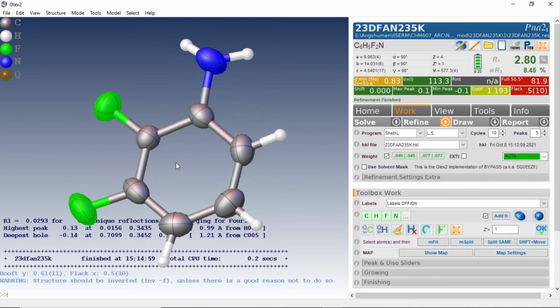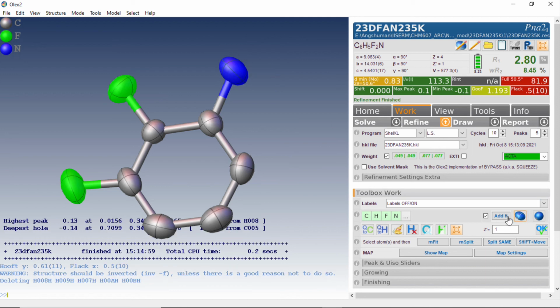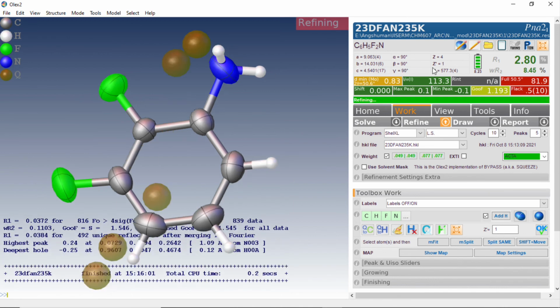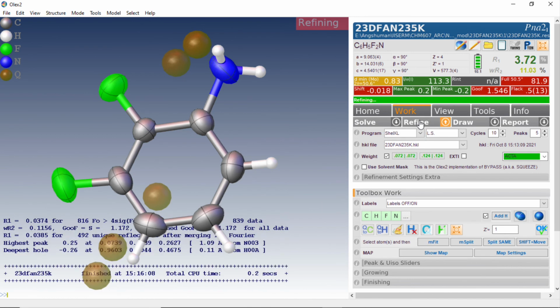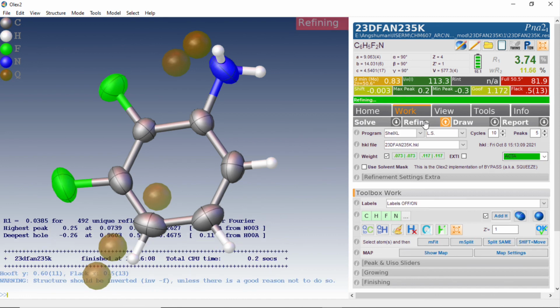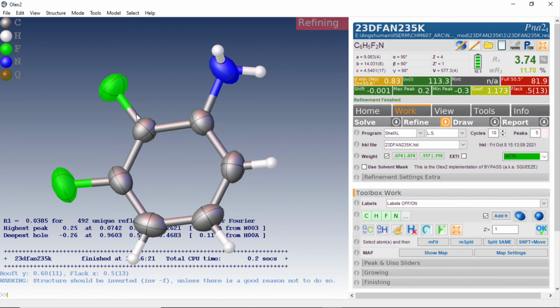Now what we see here is, although those hydrogen atoms were coming up, the bonds are not at 120 degree and all that. So it is always advisable not to refine hydrogens, rather fix those hydrogens using the riding model for any routine X-ray diffraction data. So we do a few rounds of refinements, and at the end of that, all these will turn out to be green, and there is no alarm or alert that is coming here. So I would say that the structure solution and refinement is complete at this point.